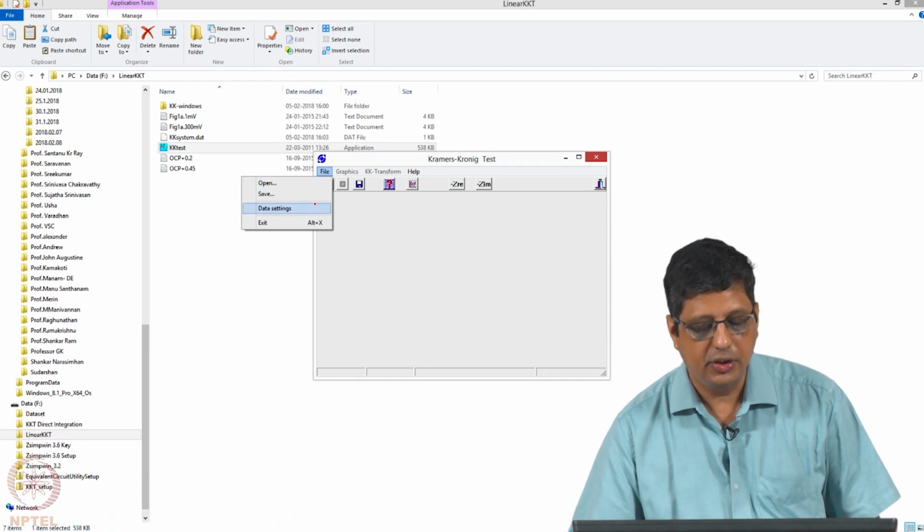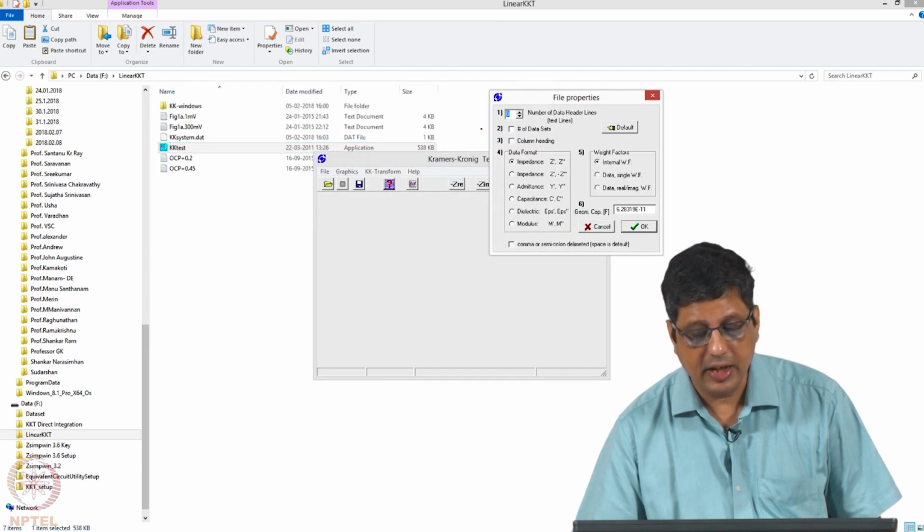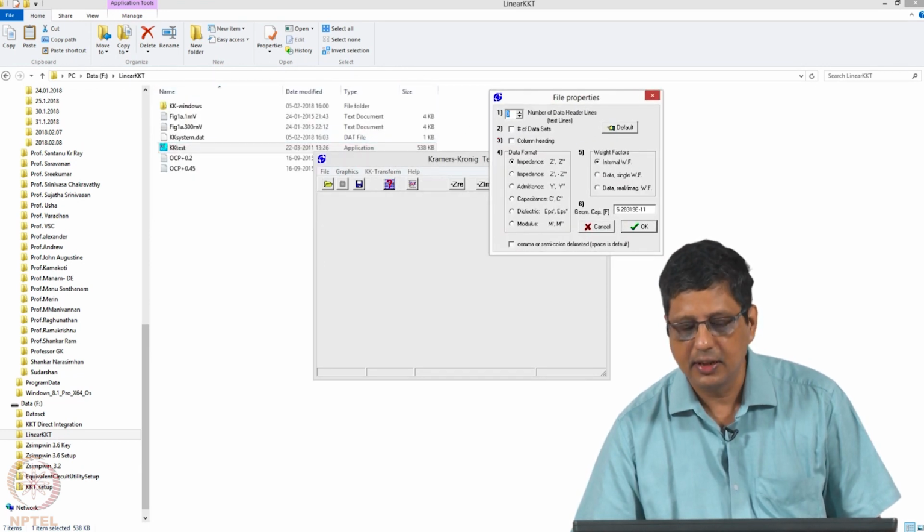First thing you need to do is to make sure that the data properties or file properties, which is basically data settings. In this case, I do not have any column header. So few settings you will have to select: 0 number of headers, this I leave it as empty, this I leave it as empty.